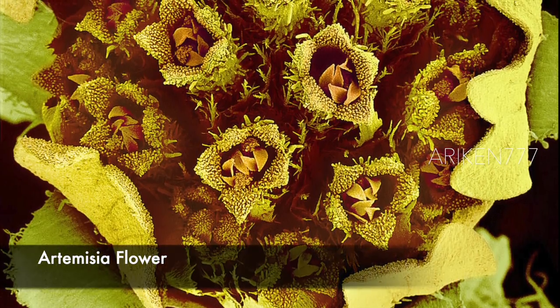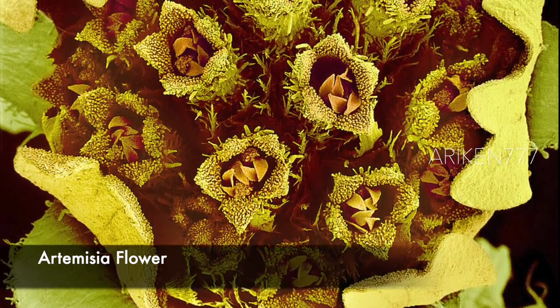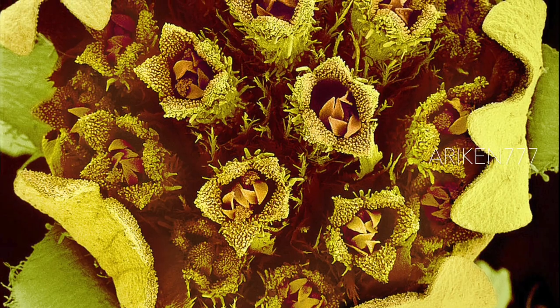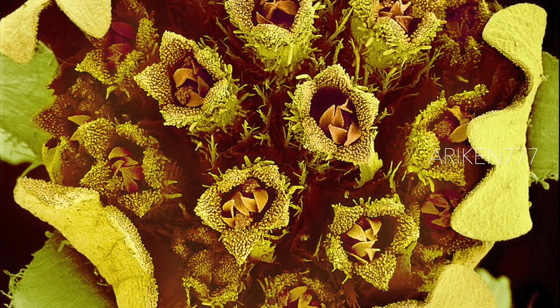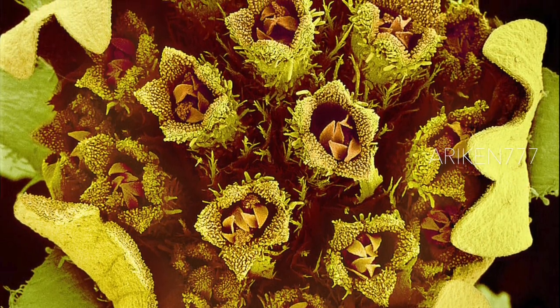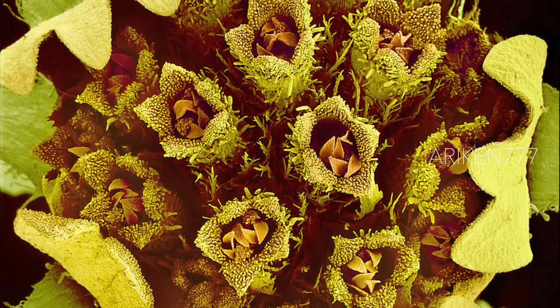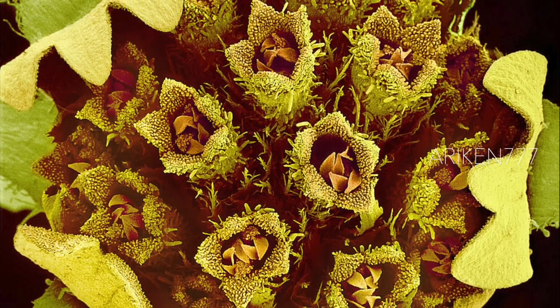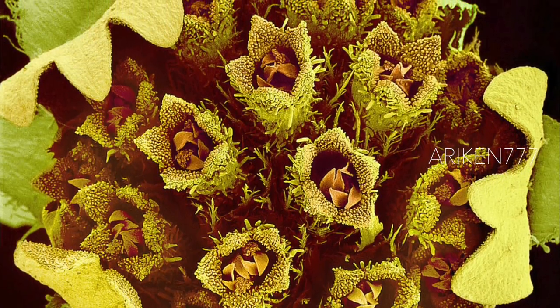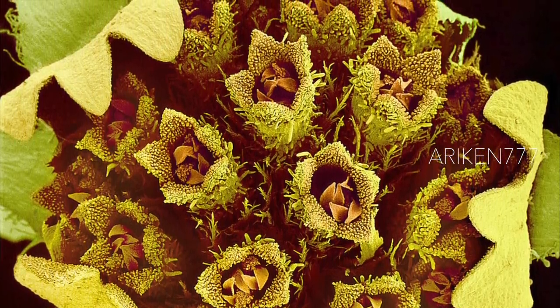An Artemisia flower. Each flower head of this flower is actually a composite of many smaller flowers, a characteristic of the composite family to which this plant belongs. Male and female reproductive structures, colored brown, are seen within each true flower.